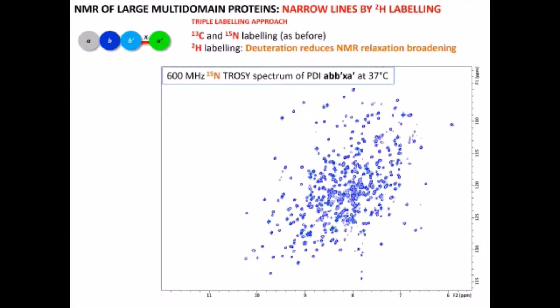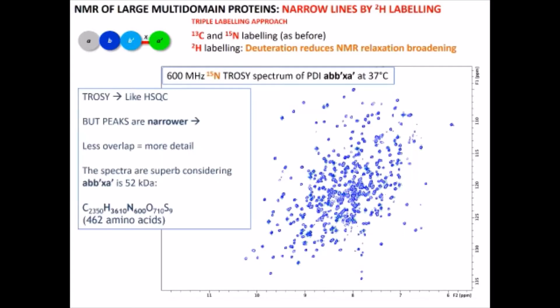So this is a TROSY spectrum, nitrogen 15 TROSY spectrum. TROSY stands for Transverse Relaxation Optimized Spectroscopy, and this is PDI at 37 degrees. TROSY is similar to HSQC, but the peaks are narrower. And there is less overlap between the different signals, so you can see the details more easily.